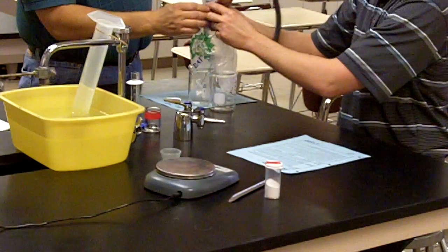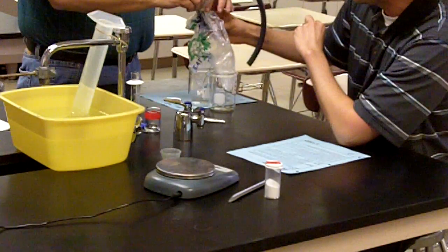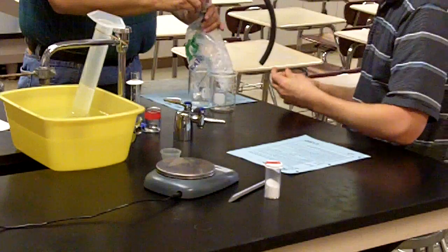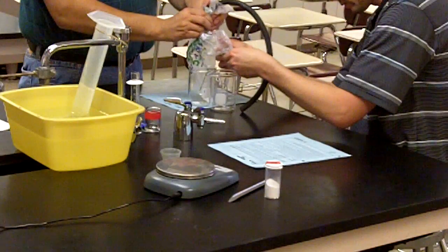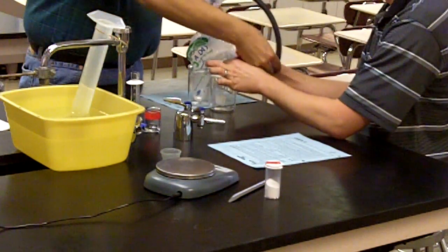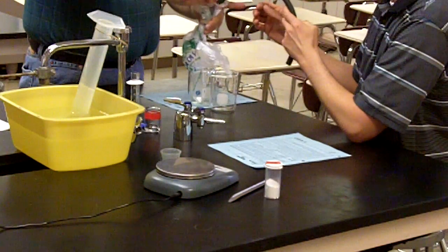Now that rubber band, after that effort, of course, has sealed the baggie around the tubing inside there. Of course, we've got to make sure that these reactants aren't mixing, but we have to get all the air out of the baggie without allowing the actual reactants to mix. Let's get one more wrap. Making sure that this is secure.